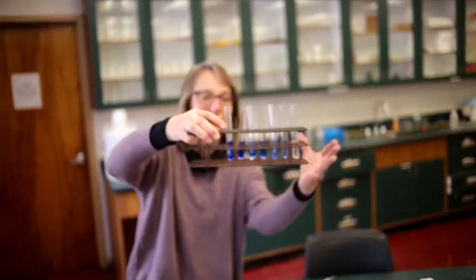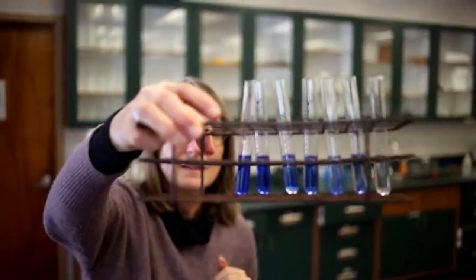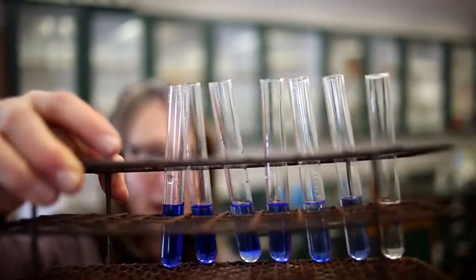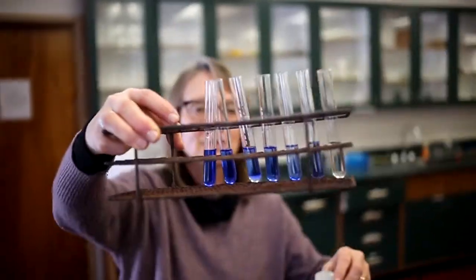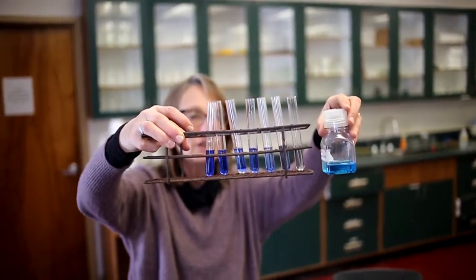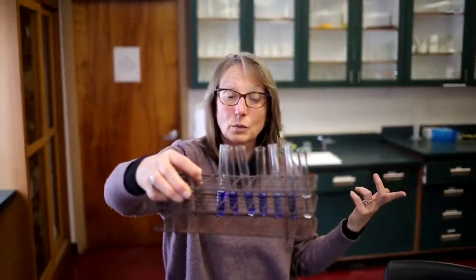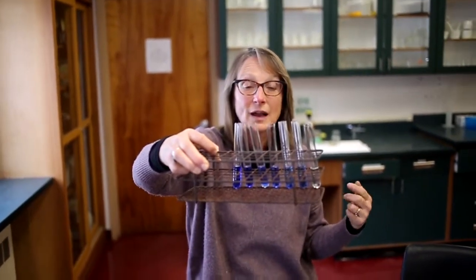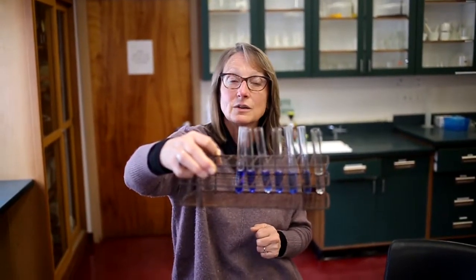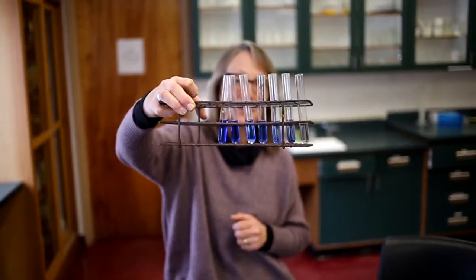So now, if we mix these up, hopefully you can see that we've created a sensitive test for really low concentrations of copper. When you compare the hue, I guess you would say, if you're an artist, the hue of the blue color, it's really different, isn't it? So what would we have to do to create another standard curve to measure really low concentrations of copper sulfate? Could you sort of imagine that you can use chemistry and sort of clever tricks to create a test that could very accurately measure low concentrations of copper sulfate by adding another chemical?